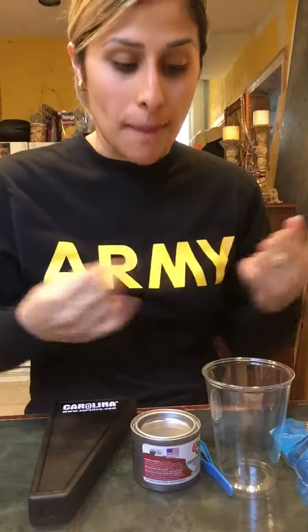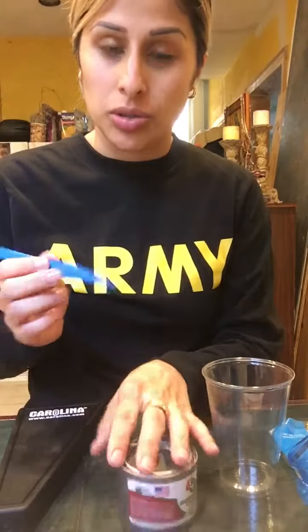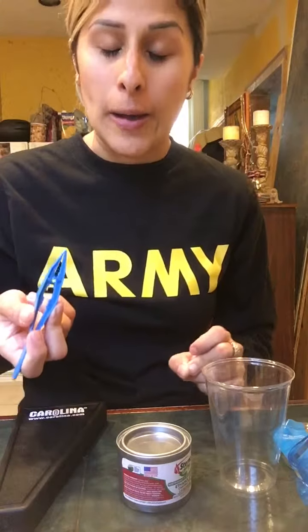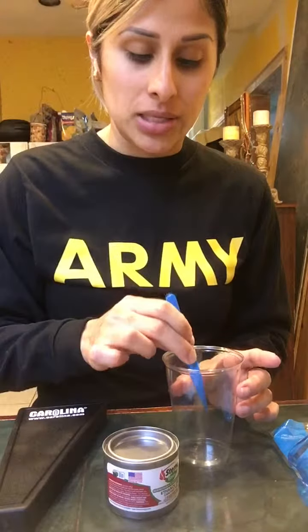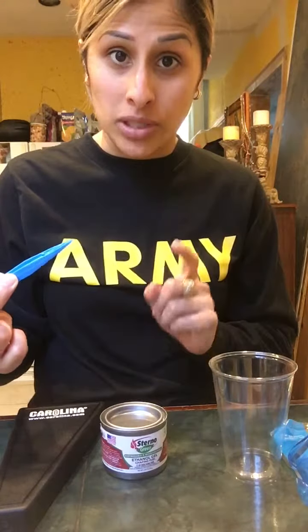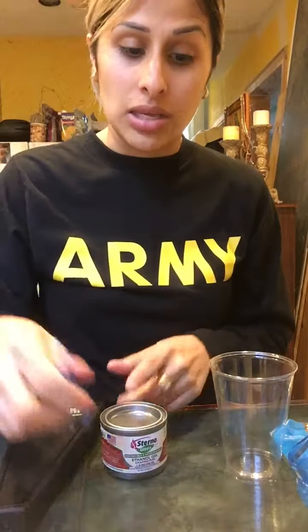For activity number 3, we're going to be conducting the flame test for the metal ions in a dark space. So for that, I am going to use the forceps and grab a piece of the flame test stick, and this cup will have water, and I'm going to dip it into the water, and then I will carefully put it over the Sterno can's flame, which will already be lit. Carefully put it over that, and it's going to reveal the unique flame color for that metal ion.